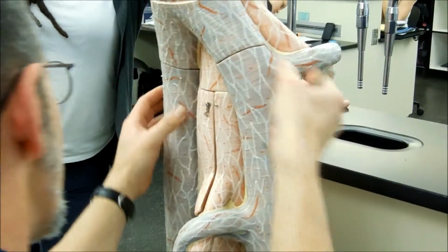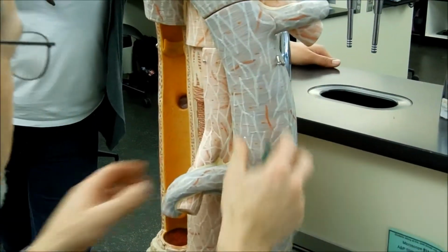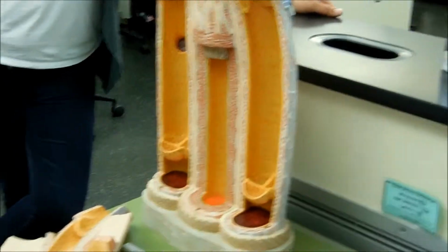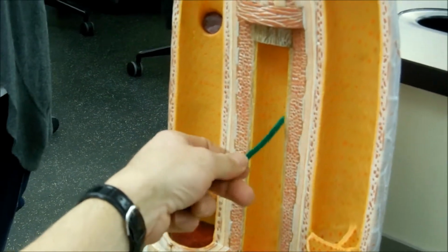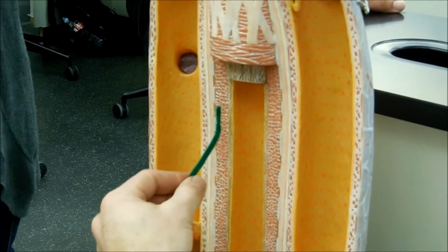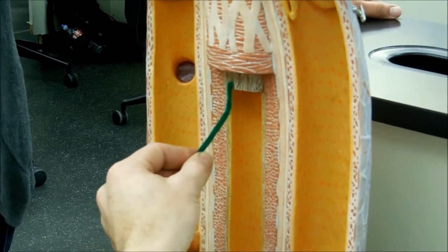So then if I open that up, there you go. I see the same thing. So I see my artery here, my veins. Let's do the artery. So I'm touching the yellow. That's going to be the endothelium of the tunica intima. That's the innermost of the innermost. And then it's going to have a basal lamina. It's connective tissue right there, which is the color you see here.